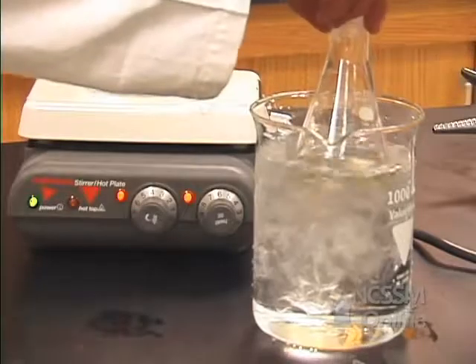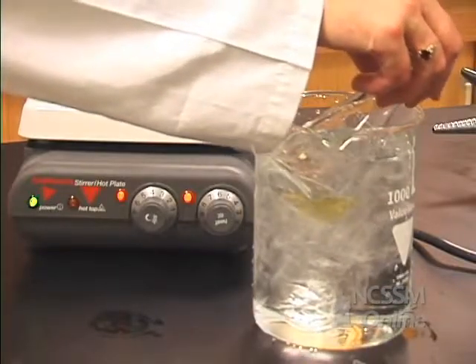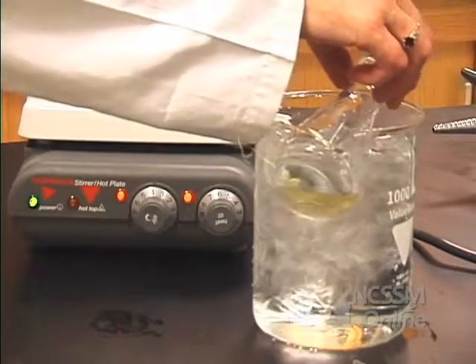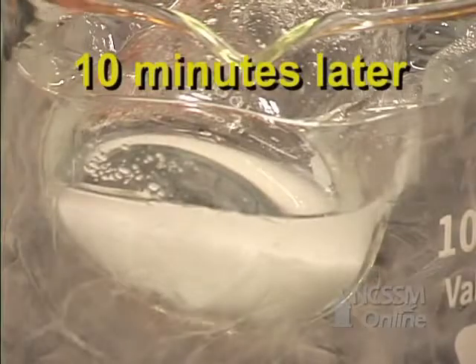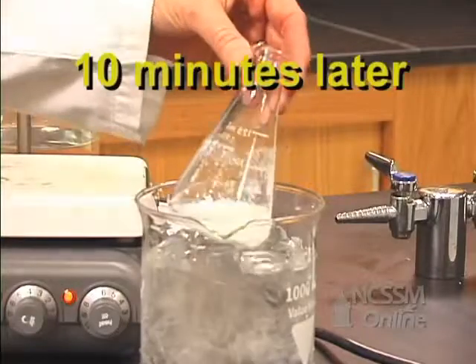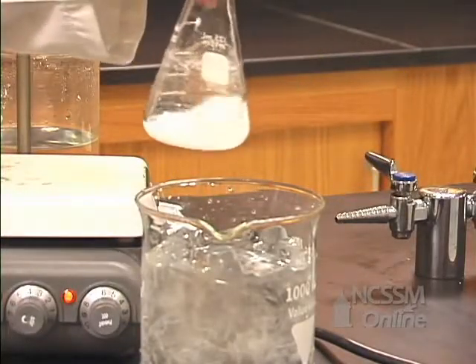Now we're going to put this in a cold water bath and allow the aspirin crystals to form. So you can see we have lots of aspirin crystallized in our Erlenmeyer.